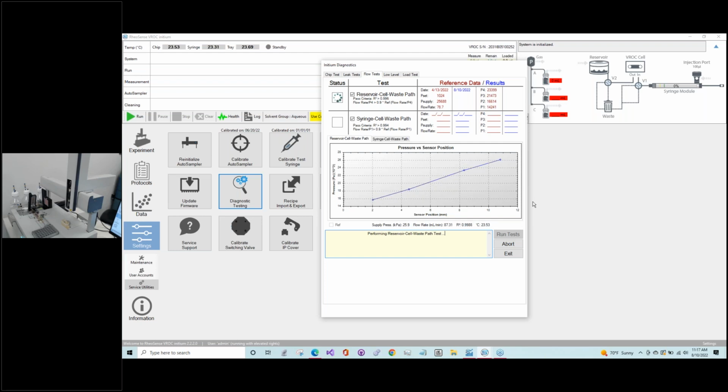So the reservoir cell waste test is taking us through this path, and it's sort of a reverse flow. And so that's going to confirm that we get flow through the chip and flow through certain positions of switch valves, both one and two.